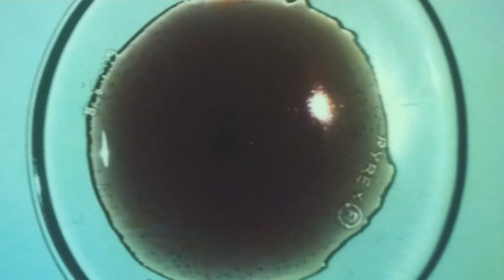And there's sort of like a shadow underneath, it's a shame. But using the silver, you can sort of seed it in certain areas and draw a little pattern, and then the waves will emanate from wherever you draw the pattern. See if I can get that to work. It's a little dark underneath. If we had some lighting from underneath, that would be best, but I don't know how we could do that. You just have to see what you can.